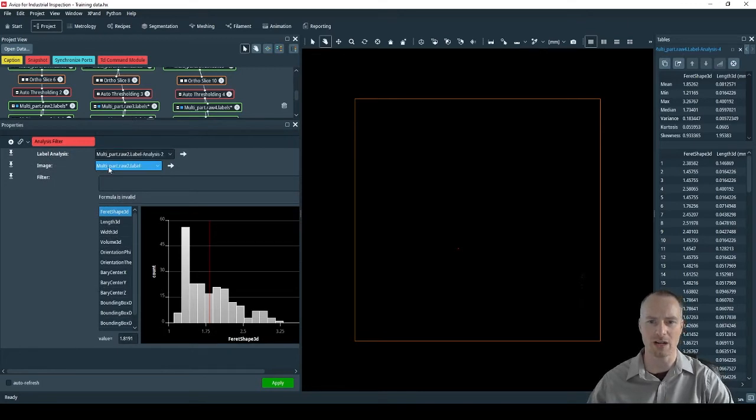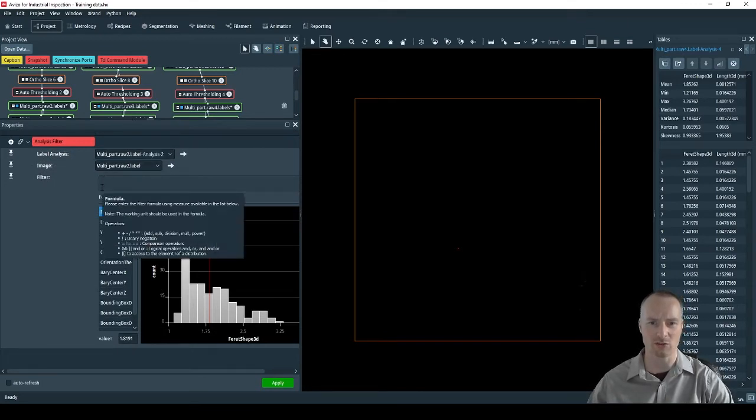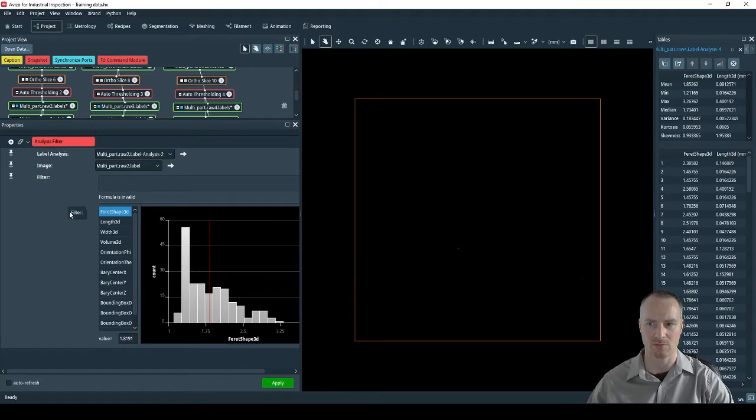In this example, I know that any data which is below 60 microns is going to be image noise. By using the bounding box in X, Y and Z, I can eliminate any pores below this measure.